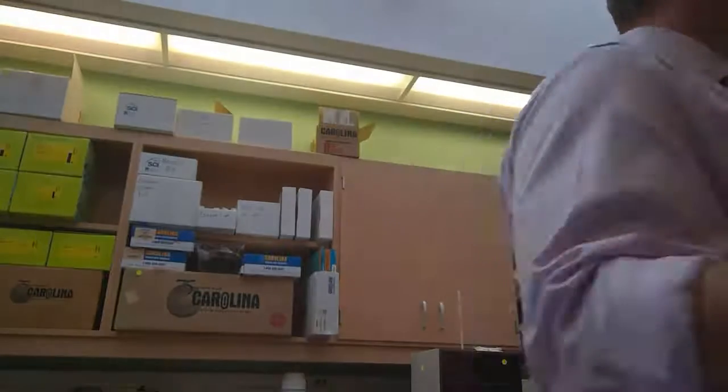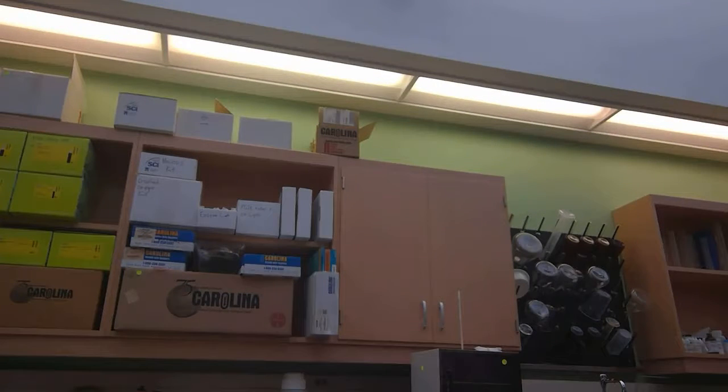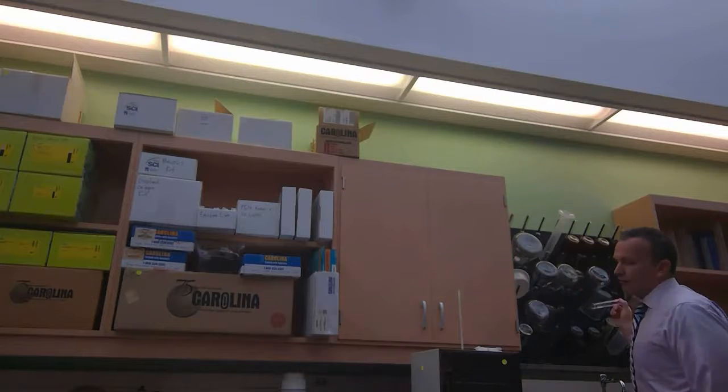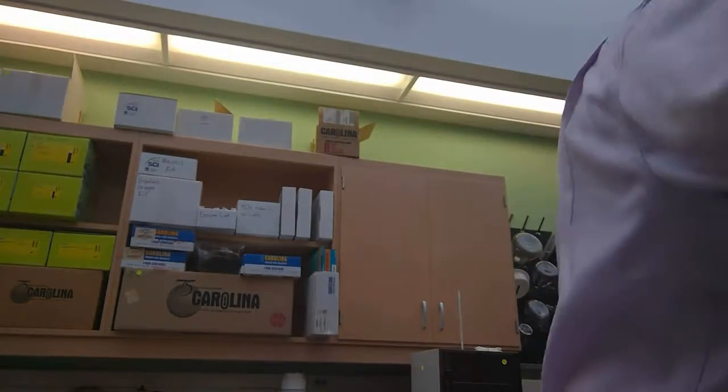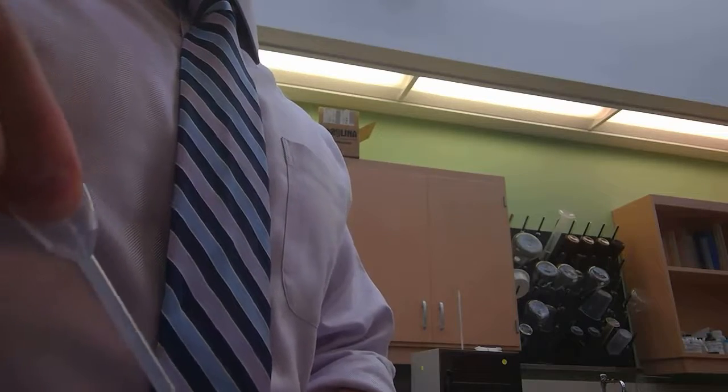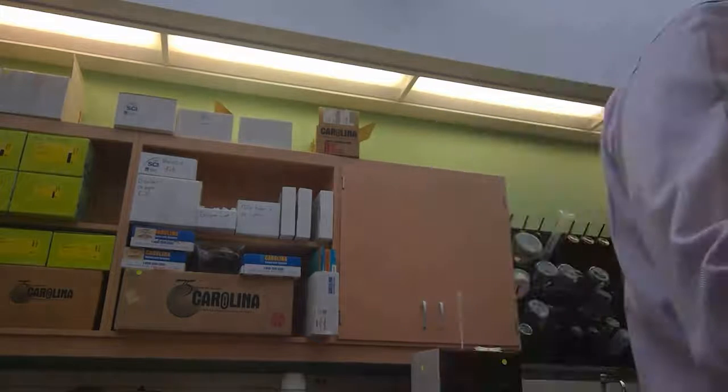So we're going to be doing a Benedict's test first, right? Benedict's is blue. This is Benedict's. From the protocol, how many milliliters of Benedict's should I add to my sample? 3. How many milliliters of my sample should I have? 3. Okay, so we're going to take glucose. I'll add 3 milliliters of glucose. This is the same protocol you're going to use. So I have my 3 milliliters. I add how many milliliters of Benedict's? 3?